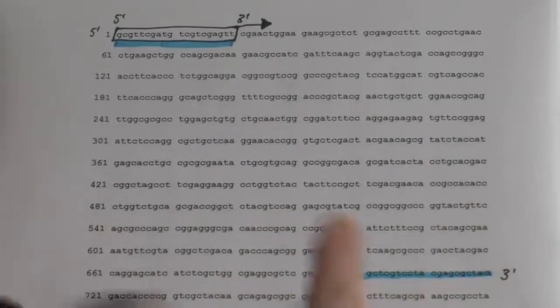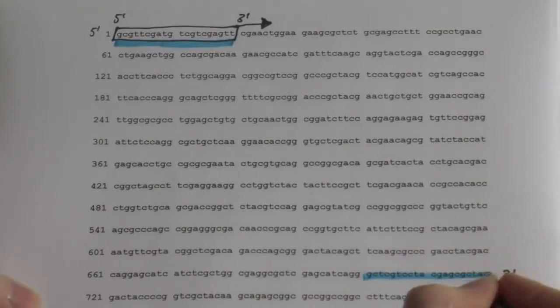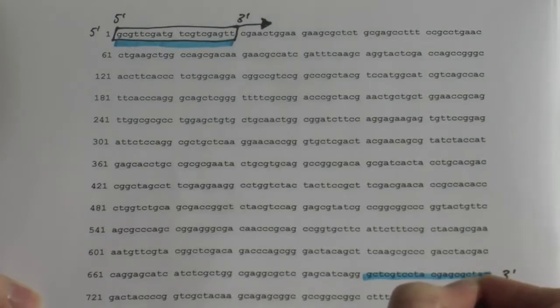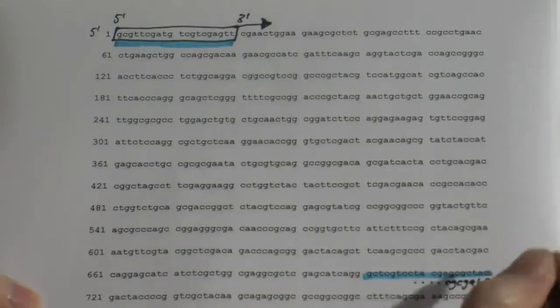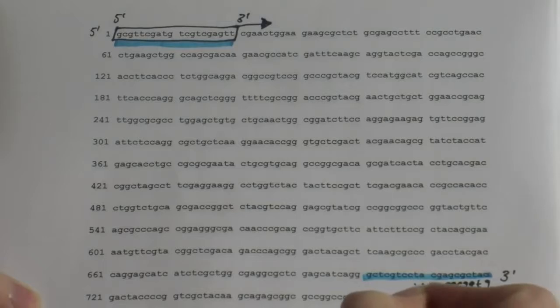Now the primer binding site in this case is the sequence that we can see, which means that my primer will actually be the reverse of the primer that we can see here, the reverse and the complement of it. So my C becomes G, A becomes T, T, A, G, C, G, C, all the way along. So that my reverse primer becomes this sequence here.